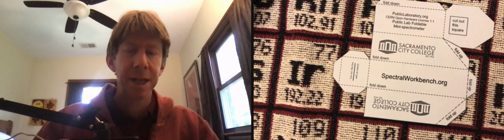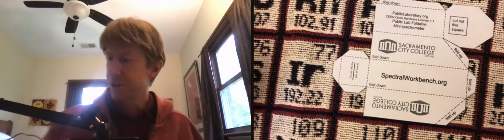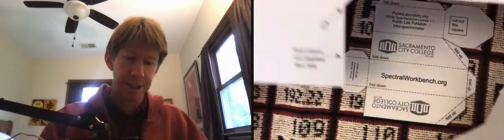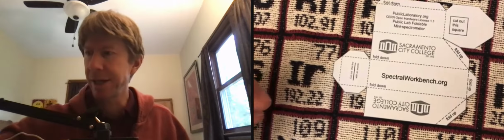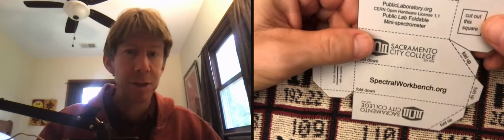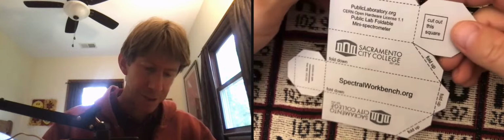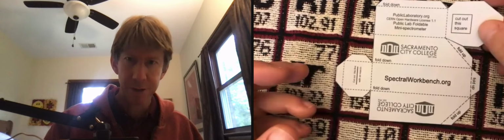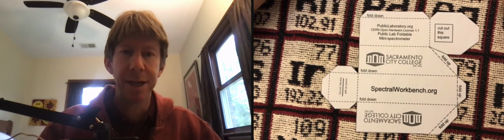Let's make a foldable spectrometer. I've taken the sheet that came in the lab manual and cut out the edges of one of them already. So you've got two just in case you want to give one to a friend or you make a mistake. And you're going to cut out the outside portion of this, except you're also going to cut this line here. So it should look like this when you cut it out.